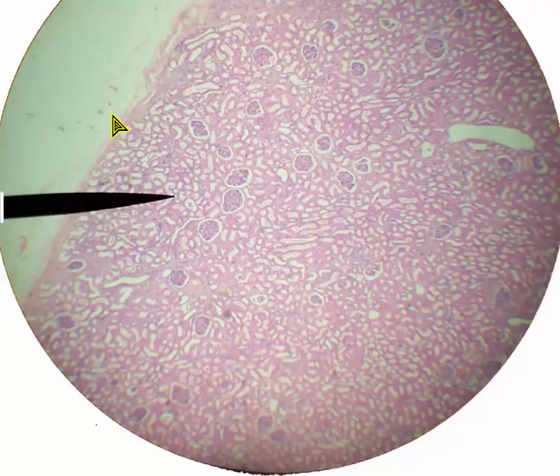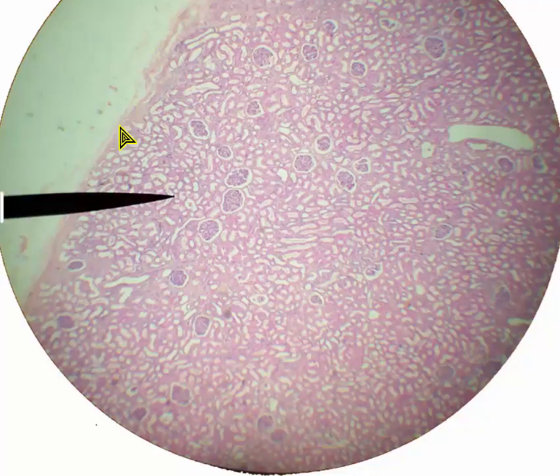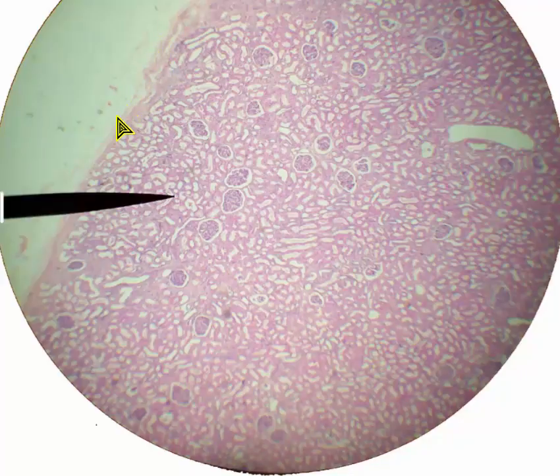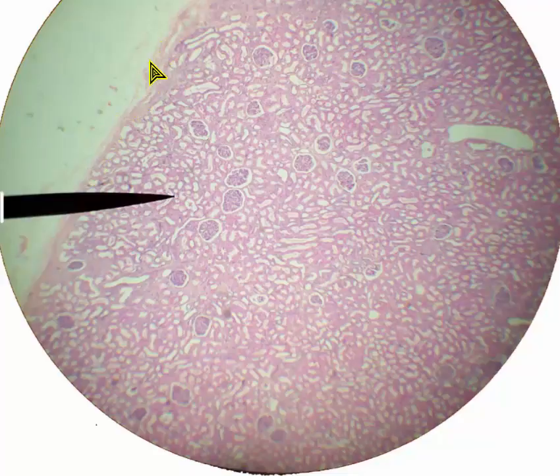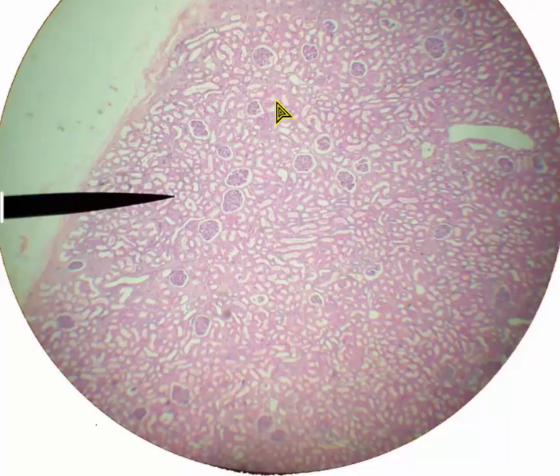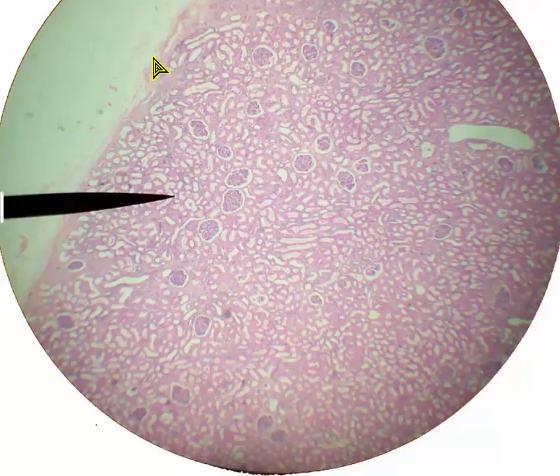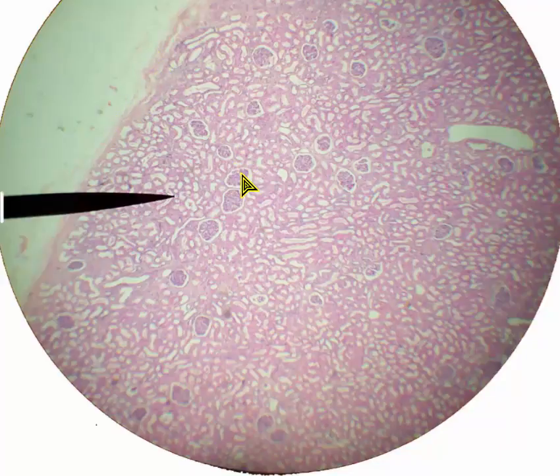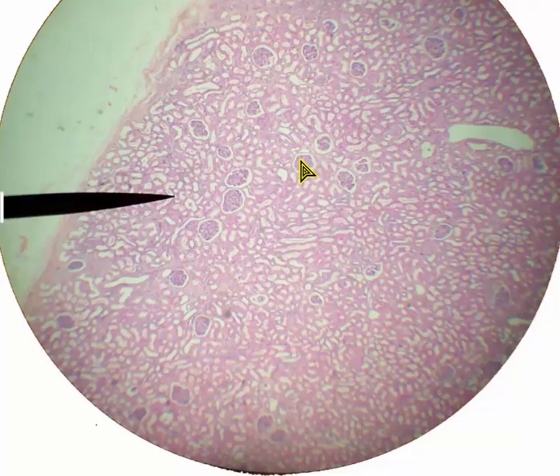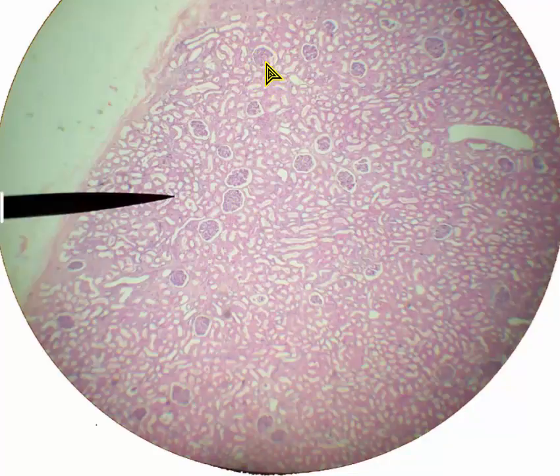This is human kidney at 40 times magnification. We're looking at the surface of the kidney out here. So this would be renal capsule — this connective tissue that you see out here on the outside of the kidney, that's renal capsule. Under that capsule we have the cortex of the kidney. I know that this is cortex not only because I see the outside of the kidney here in the renal capsule, but because I see all of these kind of darker roundish structures that have another rounded area outside of them. These are the renal corpuscles.